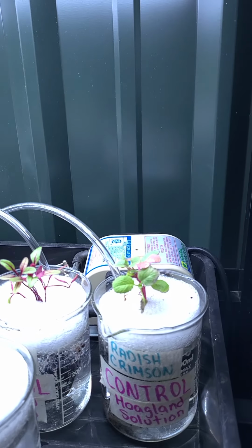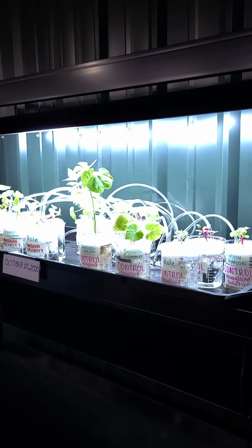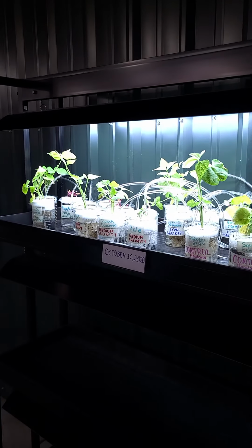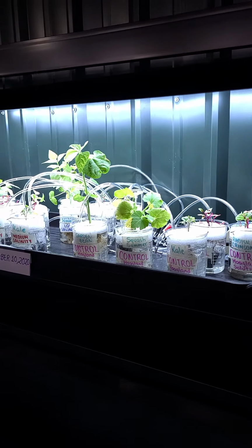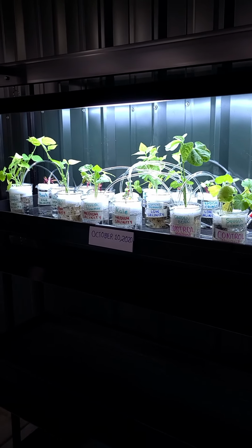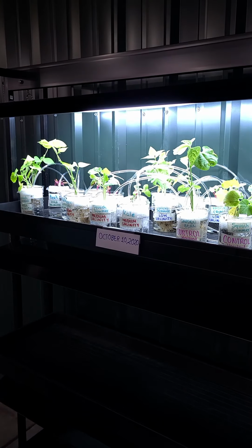This is a nice little deal. We've got lights up here which you can't see, but the lights are grow lights. And so the wavelength for these plants is just like sunlight. It's perfect for them. So we'll leave these on 24 hours a day, and they'll just grow. They'll get all the light that they need. So the only limiting factor here for these plants should be the level of salinity and how well they're able to tolerate that. So we'll come back in a week or so and have a look and see.